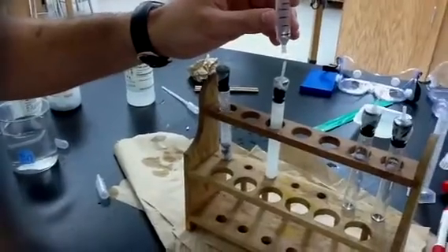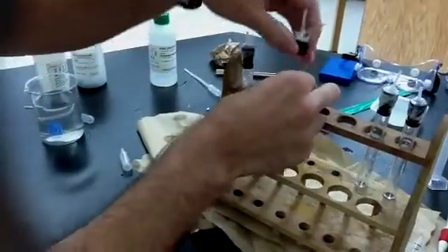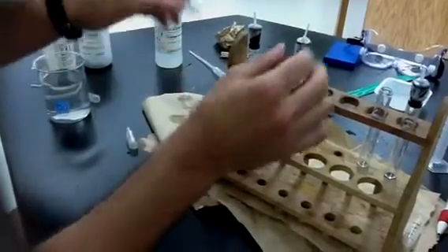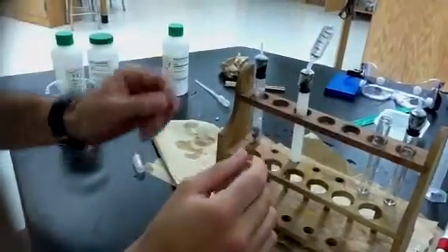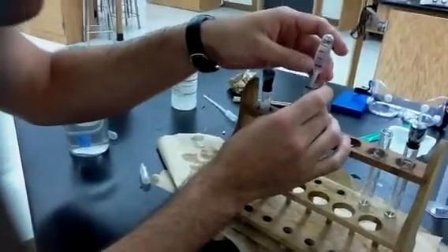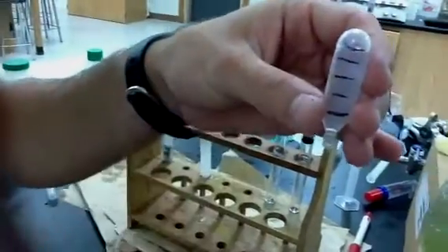I'm going to go ahead and pop on. You know what? Unfortunately, I'm going to have to switch these because this generator is not working so good. Switch to this one. This one's better. Okay, I'm going to go ahead and hop on my bulb. Okay, so we're going to see bubbles. So there we go. We see bubbles start to enter. Those bubbles are the oxygen gas. They are displacing the water. So as the bubbles enter, we see we have 1/6 of oxygen gas in there.